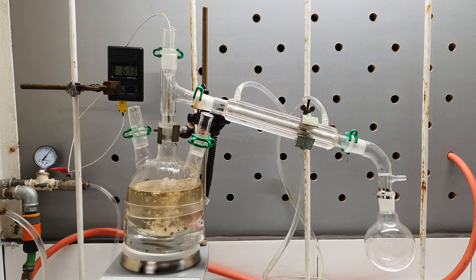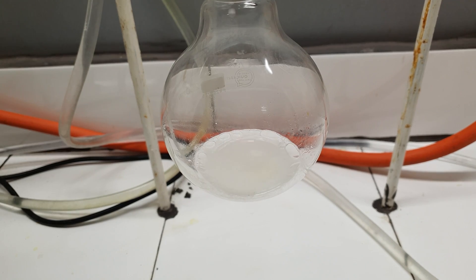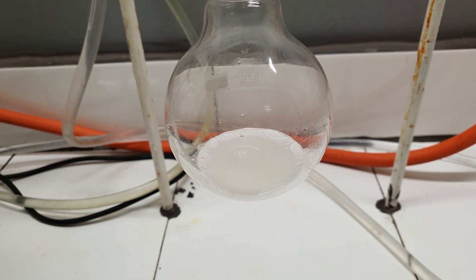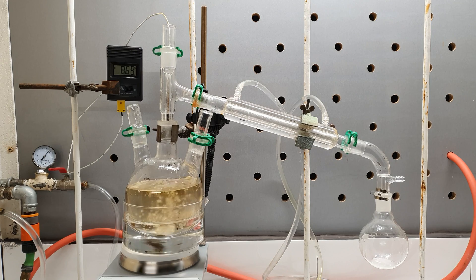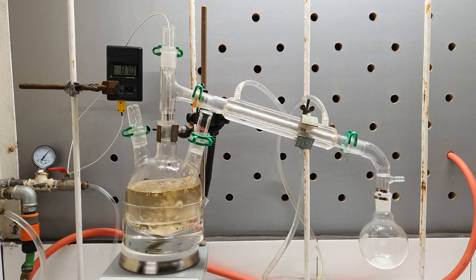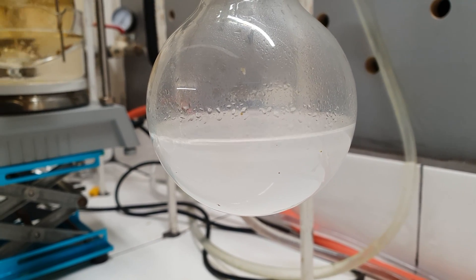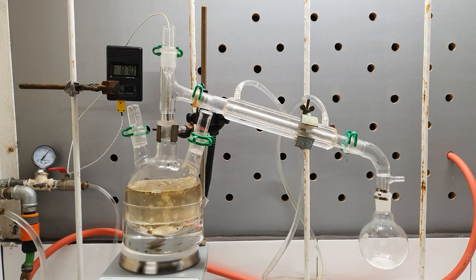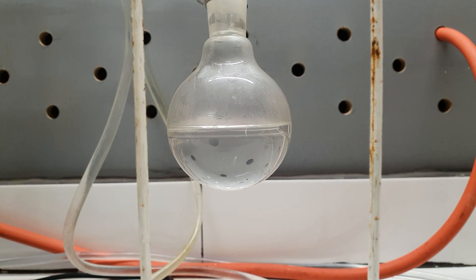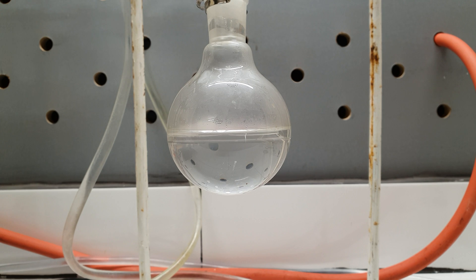I rearranged the flask for a simple distillation and continued the heating. Soon milky drops started to come over. Bromobutane has a very close boiling point to water, so they distill together. Halfway through the distillation, two layers separated. My product is the lower layer because it's denser.